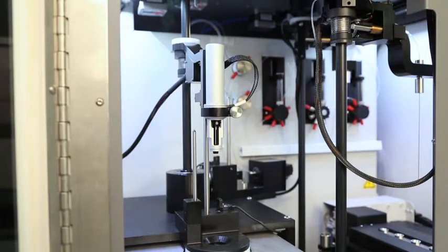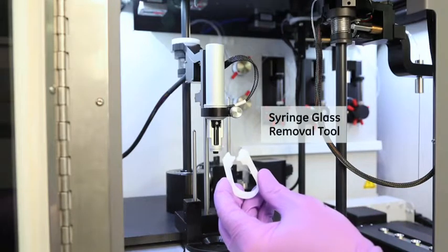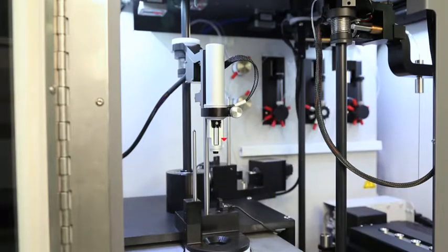If the plunger motion did not expose enough syringe glass, use the Syringe Glass Removal Tool and set the syringe glass aside.